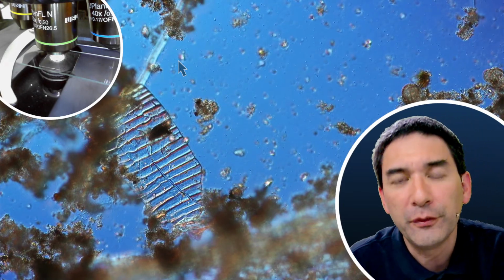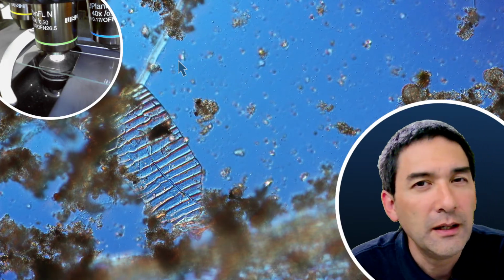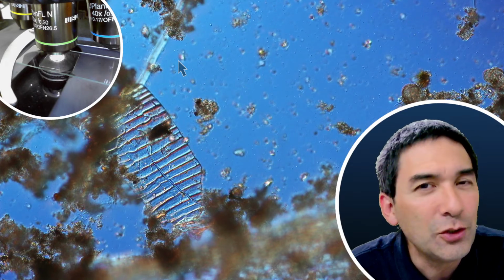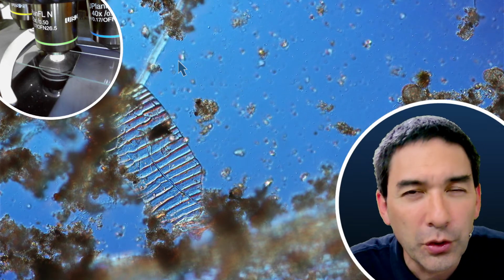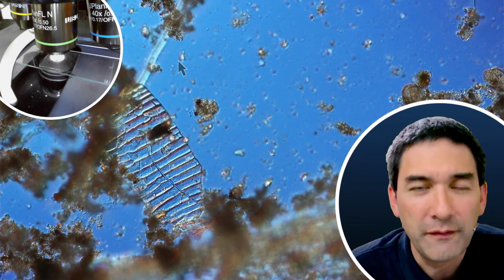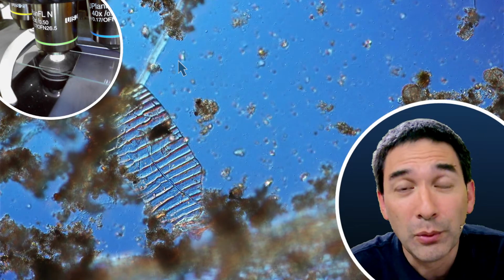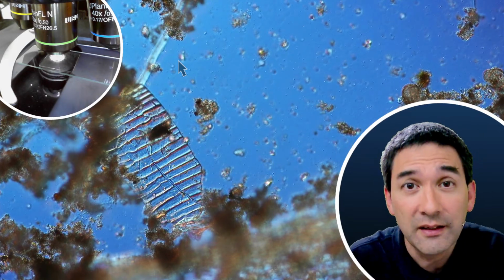And I also found the following. This is also kind of interesting: usually if tardigrades are present, then you don't have to look very long. So there is no point in really looking for hours for tardigrades. Then the moss might just not be suitable. I've had some moss samples where I didn't find anything, right? And then I've had another moss sample once, and I found 5 or 6 of them just on one slide.